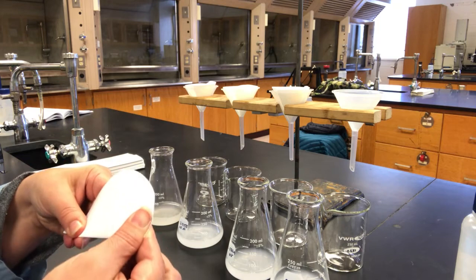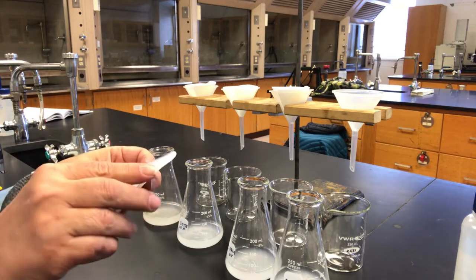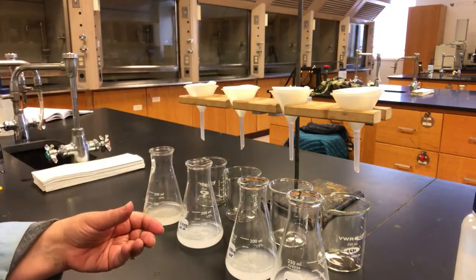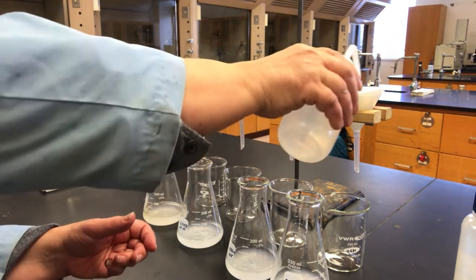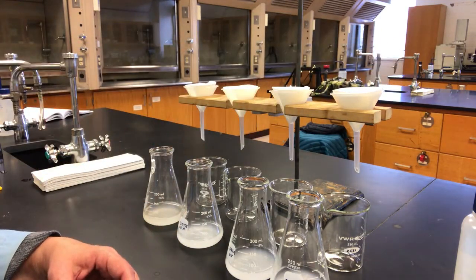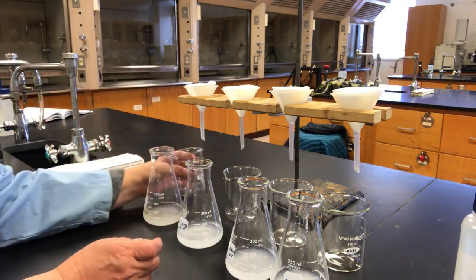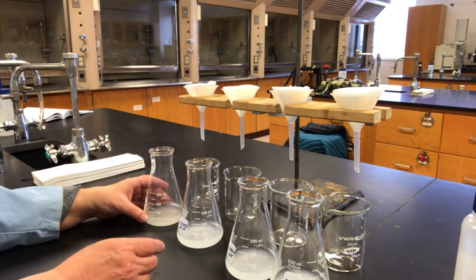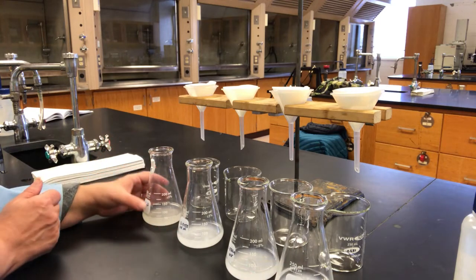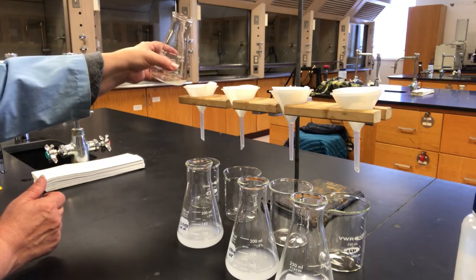I fold the filter paper in half, I fold it again, and then I open out one side like this, put it into the funnel, and wet it down a little bit so that it stays flat. This one's sitting nice and flat anyway, but wet it down a little bit to make sure it stays flat. Previously I labeled each beaker to show which solution I was filtering, and I've carefully lined up the Erlenmeyer flask to make sure that I'm not going to accidentally lose track of which solution is which. So we will pour them in carefully so that it doesn't overflow.